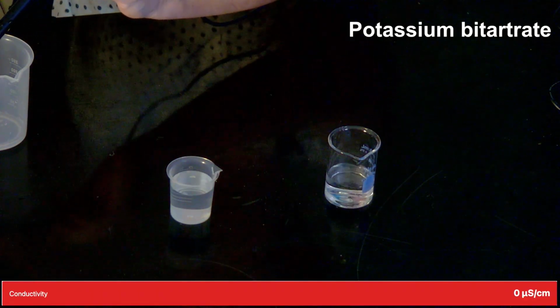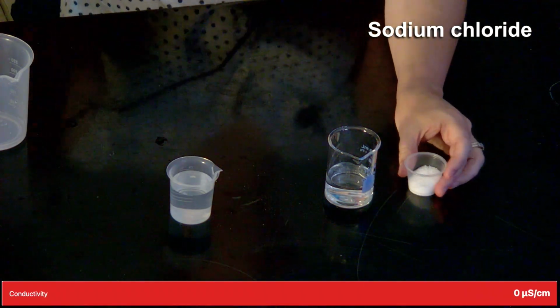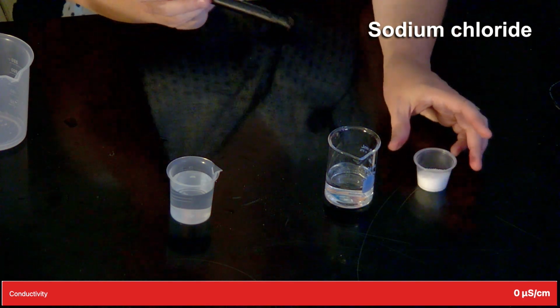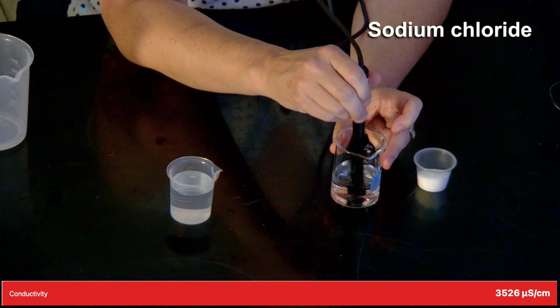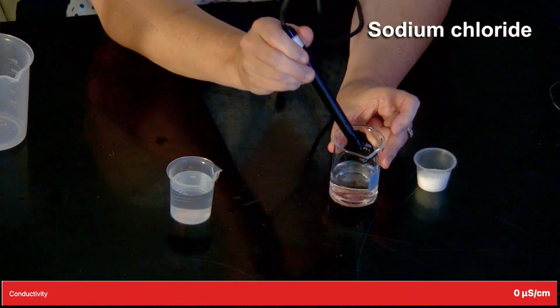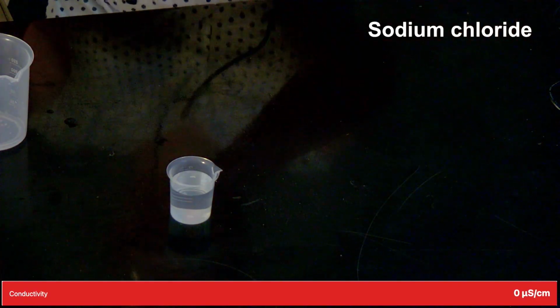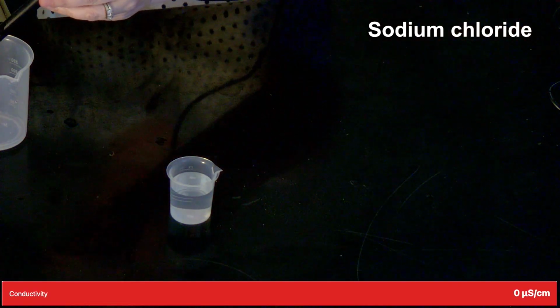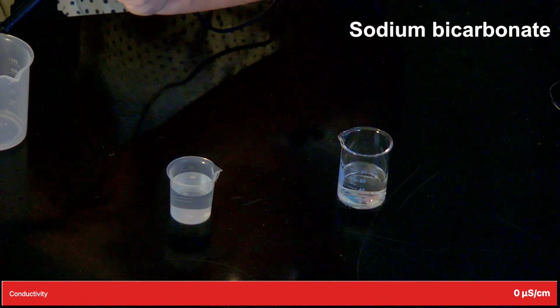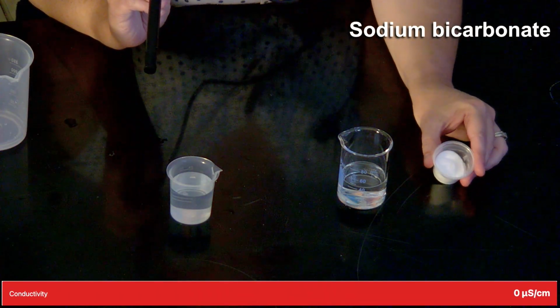Third substance is sodium chloride. And this one is that kosher salt, so it's more flaky, larger flakes. My fourth substance is sodium bicarbonate, also a white solid, a little bit more powdery.